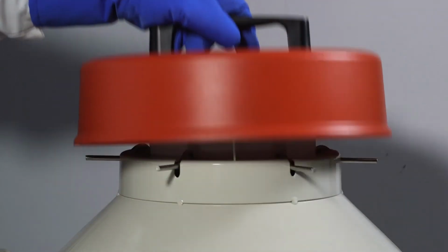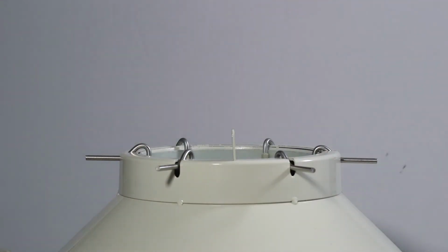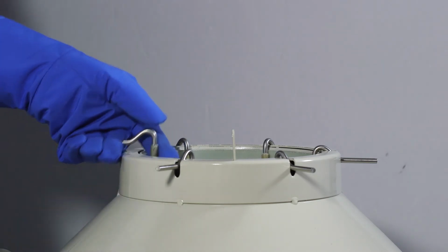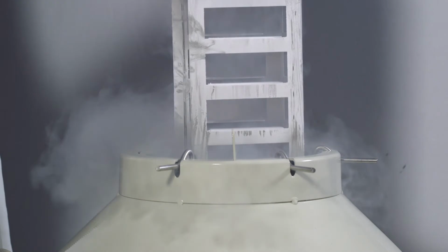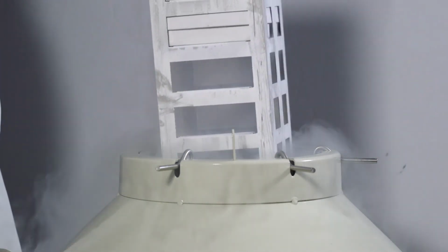Safety is another critical aspect when working with liquid nitrogen. If tubes aren't correctly sealed, introducing them to the liquid phase of liquid nitrogen can lead to explosions or biohazard leaks, devastating for a lab. Many choose to keep samples in the vapor phase of liquid nitrogen instead, but if you do wish to immerse your cells in the liquid phase, consider selecting cryotubes specially designed for this use.